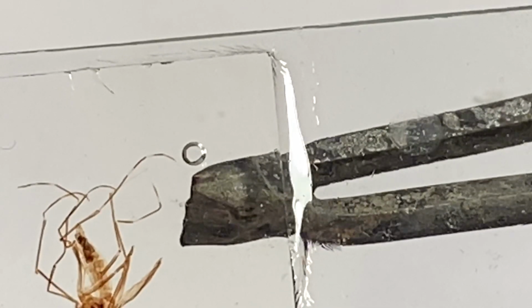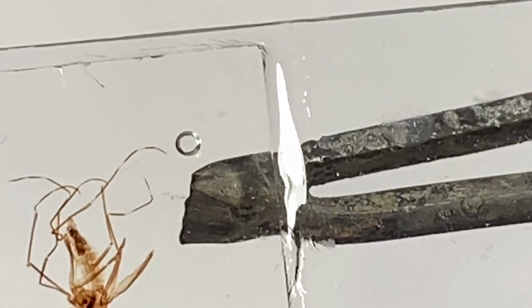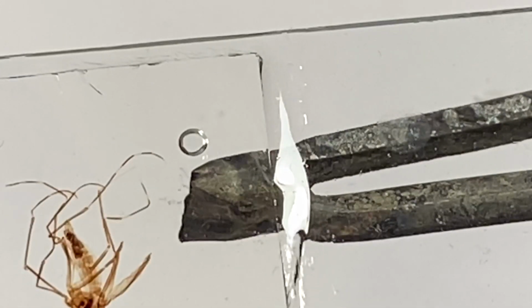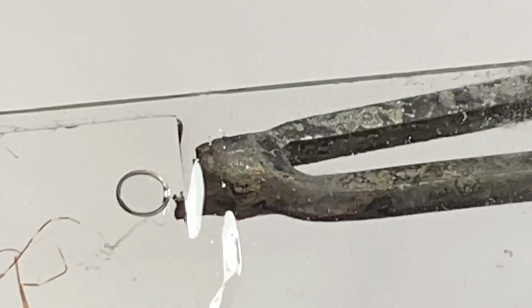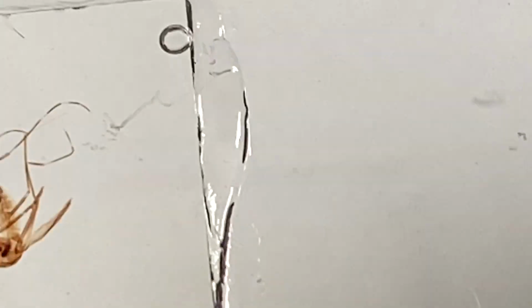Okay. And pay very close attention to the surroundings, because if you see some bubbles start to appear, what's happening is the gases inside there. It goes. Okay, there it goes. Now let's bring it over here to draw it to the outside. Okay, here we go. That's enough heat. Now if the bubble doesn't move, you can coax it by just using your finger and pushing it out. Apply a little pressure.